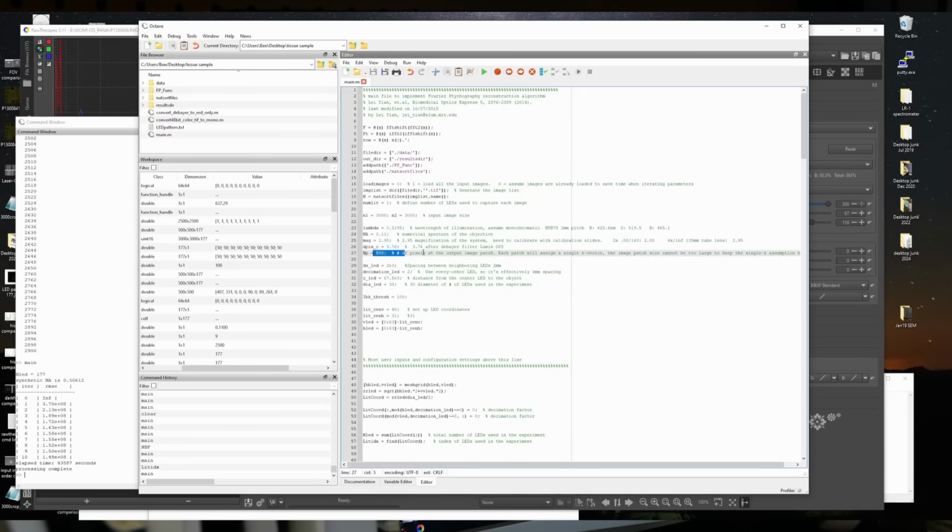One of the limitations of this implementation is that it can't improve the resolution of your input image edge to edge. It has to use a subset. So 500 pixels is going to be the subset from this 3,000 pixel square image. We need to know the spacing between the LEDs. We need to know the distance from the LEDs to the image plane to figure out the angle. Remember, what this thing really needs to figure out is the illumination angle, because that tells it what spatial frequency to assign to that illumination angle.